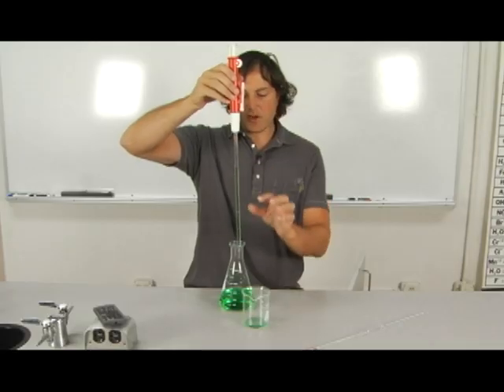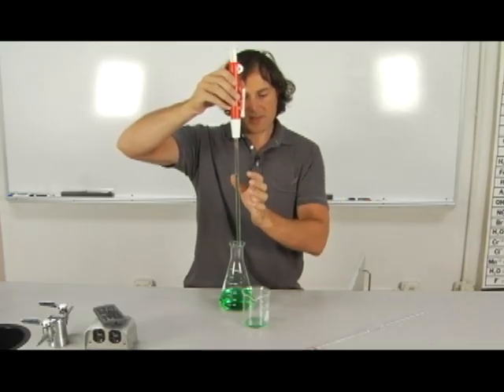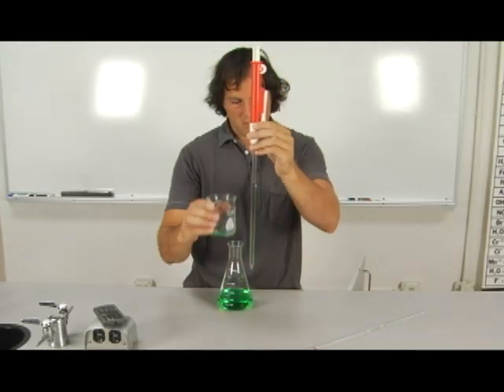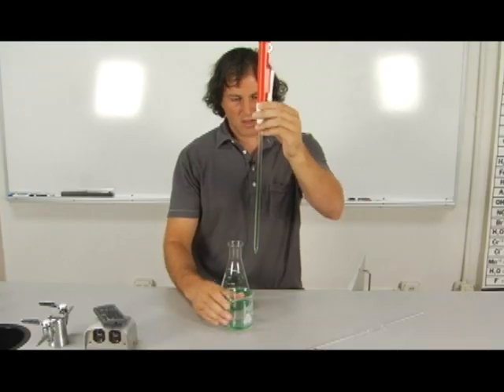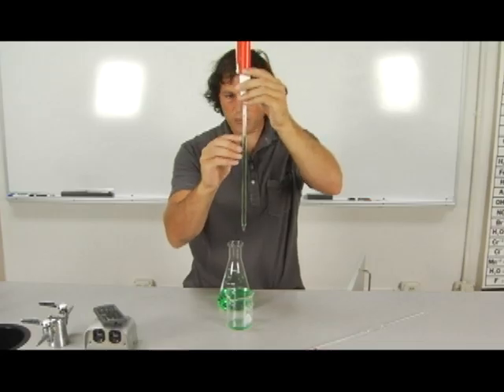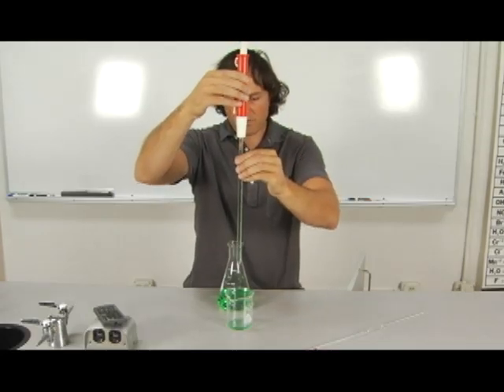So then any bubbles that come into the pipette need to be tapped out. So reading this one, I read at 0.7 right on the line. So this is 0.7 milliliters. And let's say I drained down to around 5 milliliters.